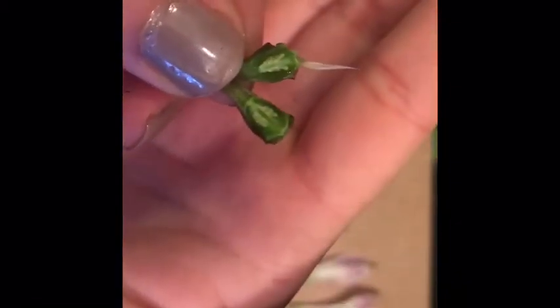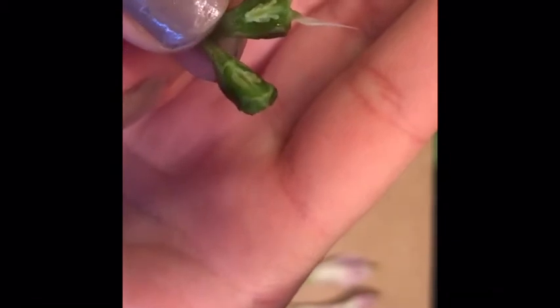The ovary, and you can see the ovules inside, or the eggs. So after that pollen comes down the tubes through the style, it gets deposited in here, and that pollen fertilizes these eggs, and it'll create a seed. And I'll also have some close-up pictures of these as well.